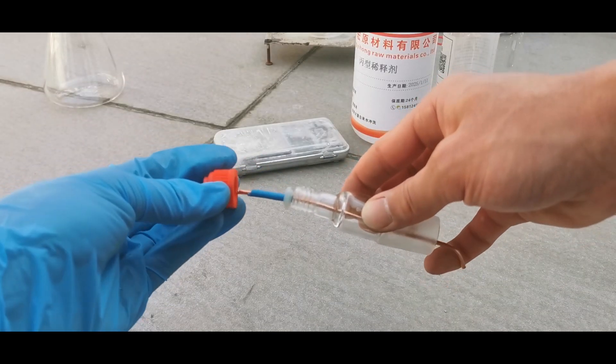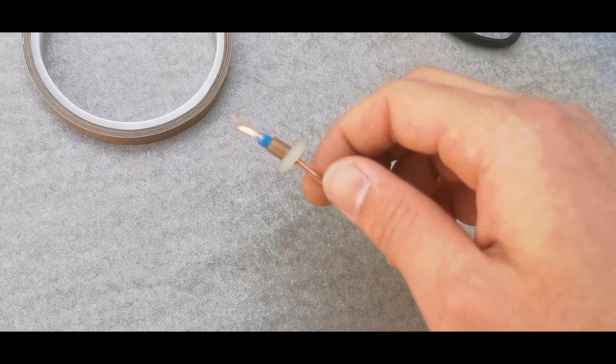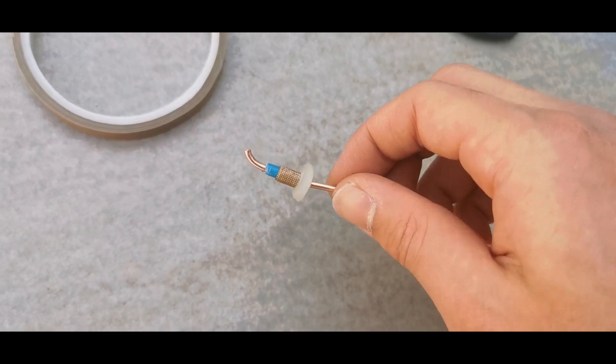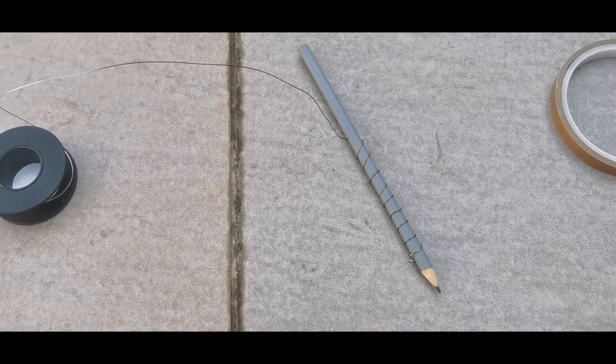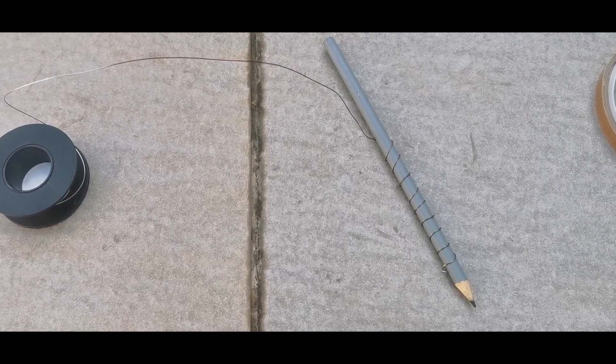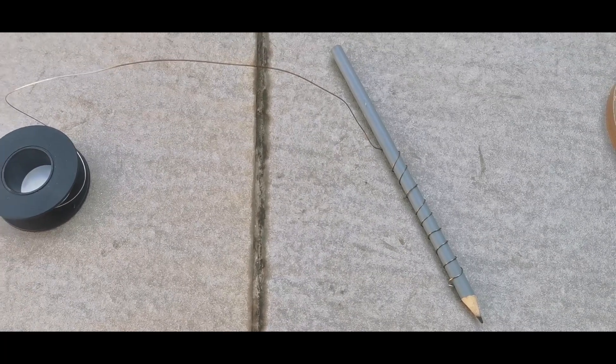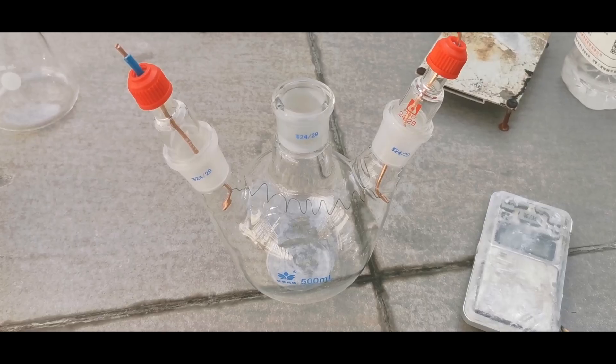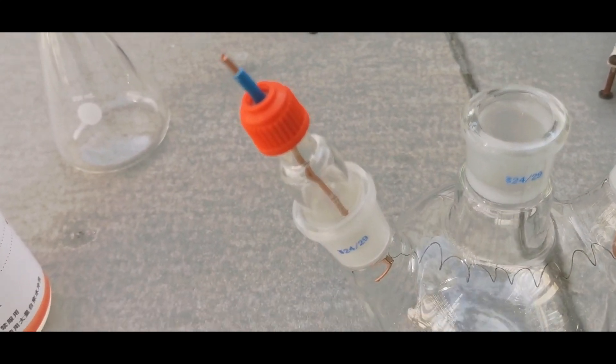I did the same with the other copper wire and thermometer adapter. The other ring was slightly damaged and got bigger, so I wrapped some teflon tape around the insulation part to ensure good seal. Now for the more annoying part, the filament. For my first attempt, I loosely winded some 0.5mm thick nichrome wire onto a pencil and tangled it between the two copper wires by first fixing one end, passing the wire through the flask, and hooking the other end with the second copper wire.